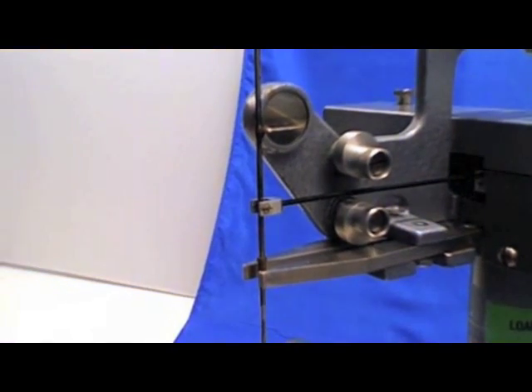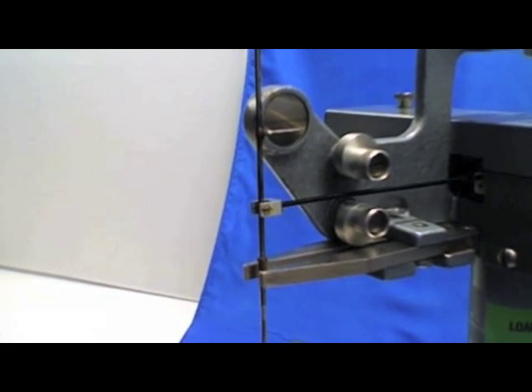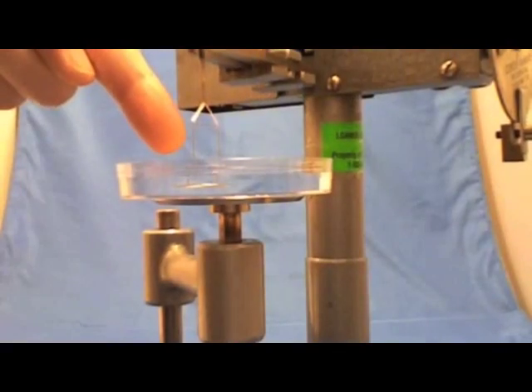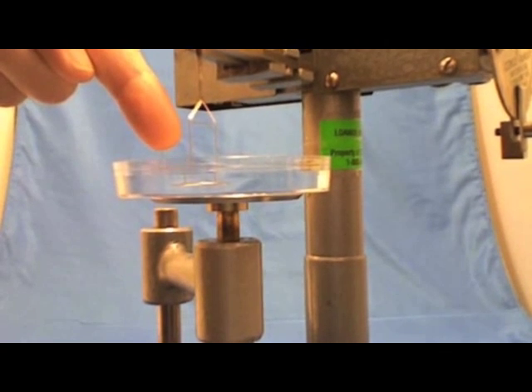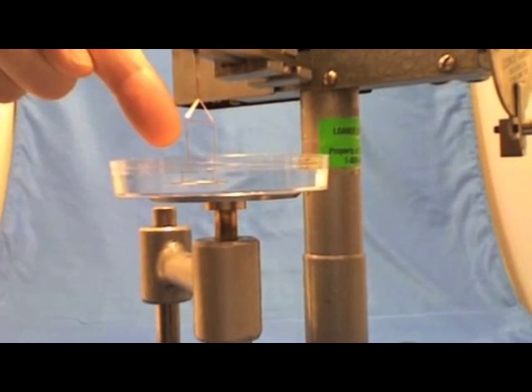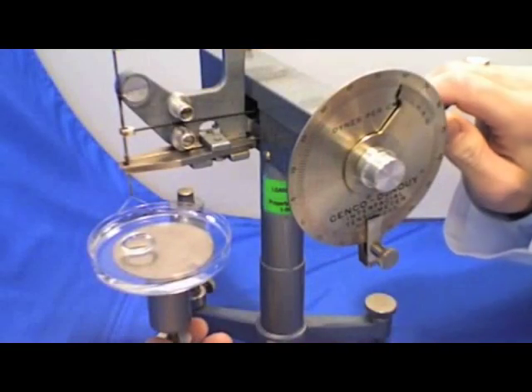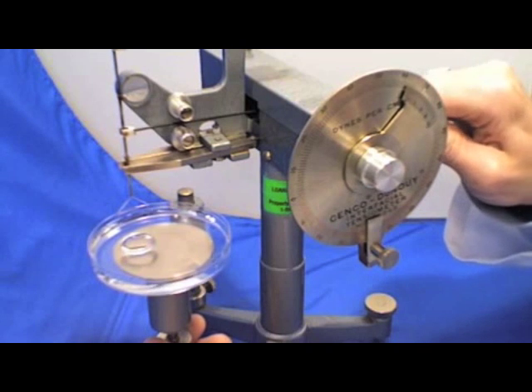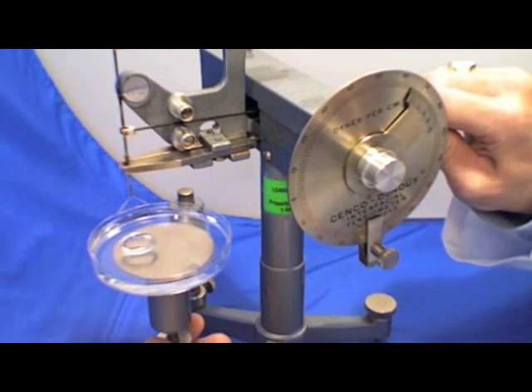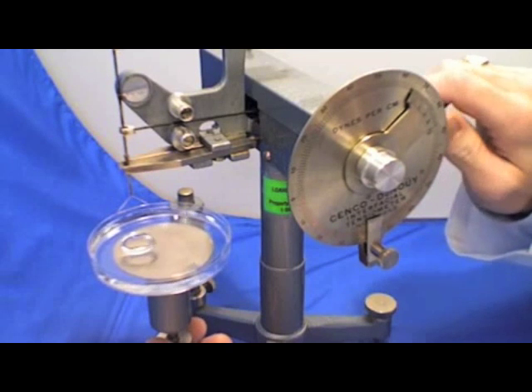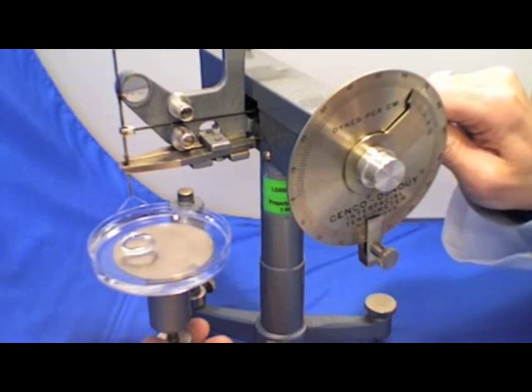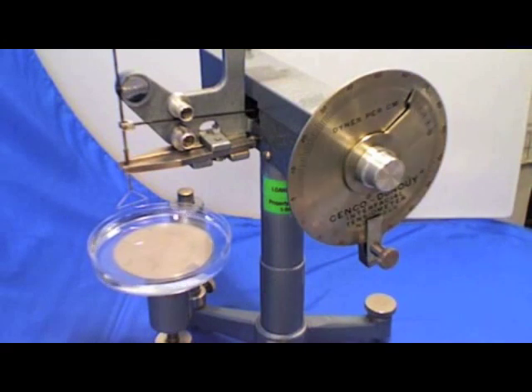The process just described will bring the ring up through the liquid surface. The process of lowering the sample stage and then countering with the right hand dial to maintain the indicator needle with the mirror line is repeated until the DuNOUY ring pops through the liquid surface.